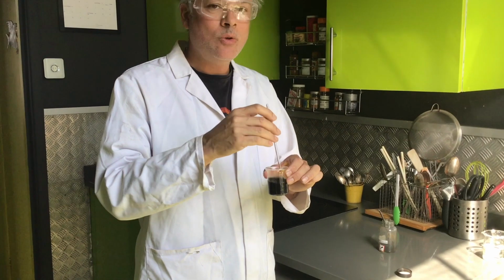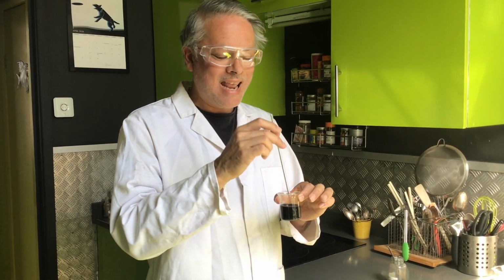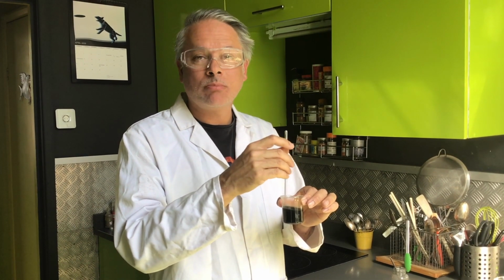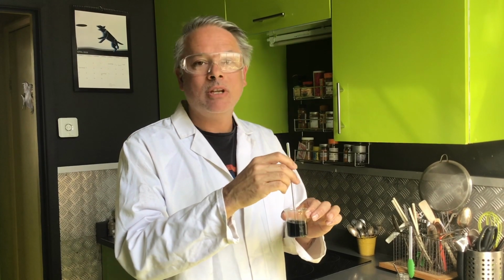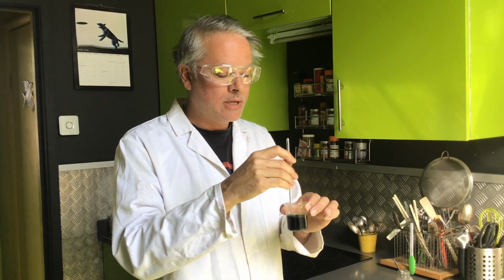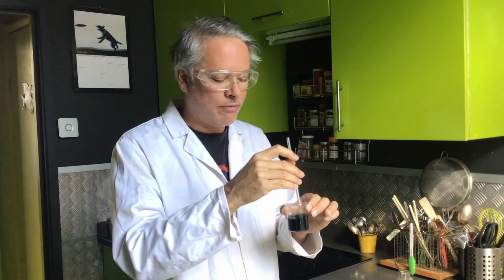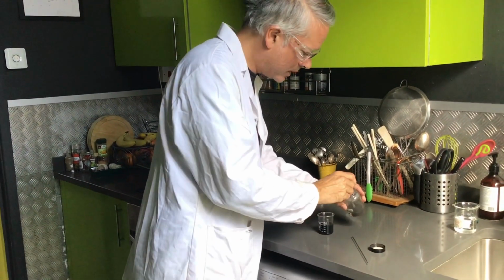And then what we want to do is chuck a bit more in and give it a good stir. The key to this, and this is the key word if you get this in an exam question, is to add an excess of copper oxide, okay? And excess means there's more copper oxide, much more than the sulfuric acid. What is the point of adding excess? Well, you need to make sure all that acid is used up, okay? When you filter it, which we're going to do in a minute, you do not want any acid left over. When you've got your copper sulfate at the end, you don't want any acid left in your copper sulfate for obvious reasons. So we chuck a good amount of copper oxide in there.